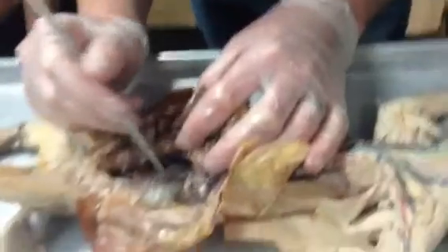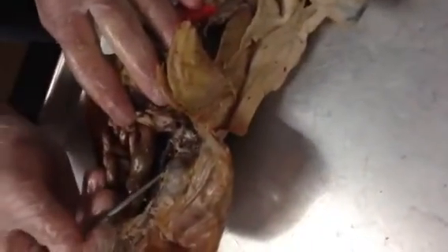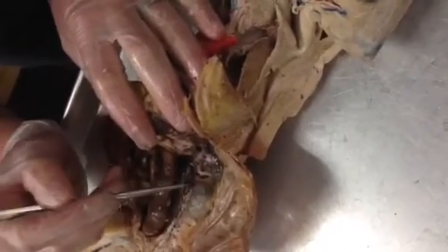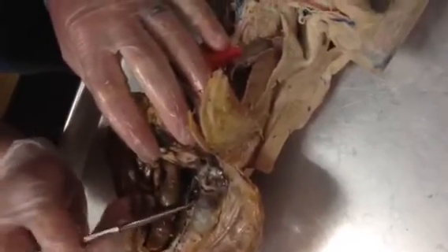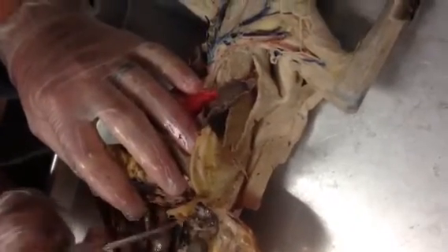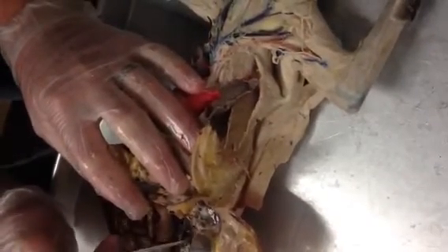They run out towards the kidney. So typically it goes veins on top, arteries beneath, and then nerves on the bottom. And so you can see right here, the easiest thing to see is the renal vein. And so deep to that should be the renal artery. I believe it's this right here. It's just not really that well injected. You can see the pink though right there.